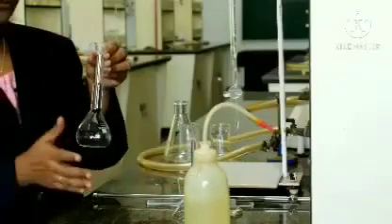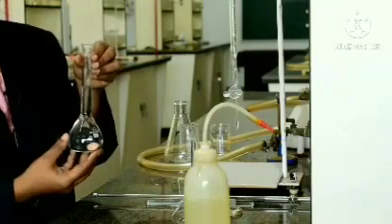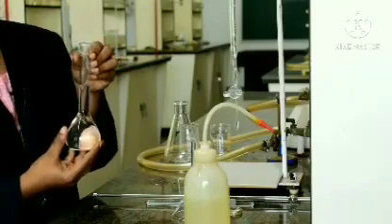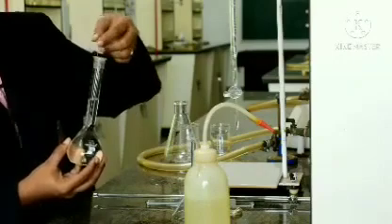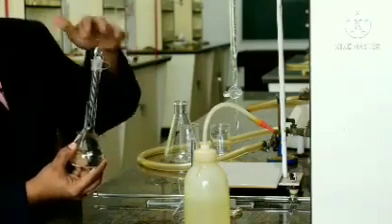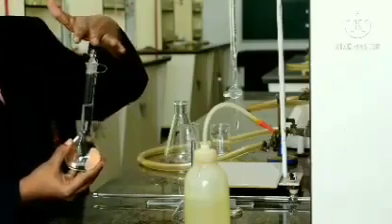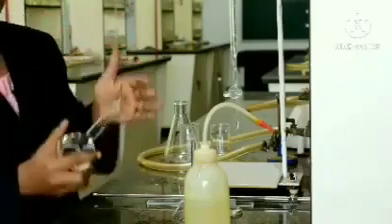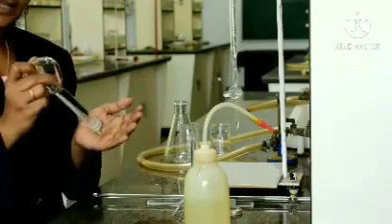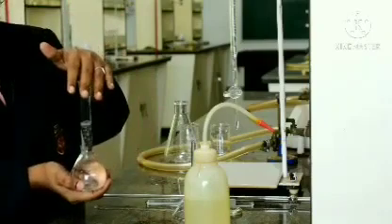Now, we have to shake the solution to make it into a uniform concentration. For this purpose, we have to close the lid of the SMF and shake it thoroughly. For this we use this method, just tilt the SMF, shake it well, do it again.